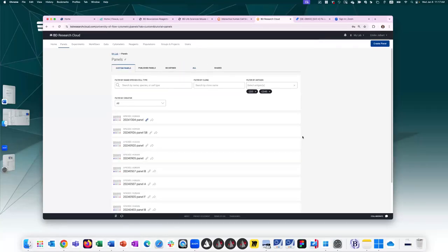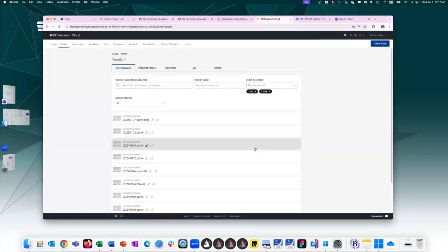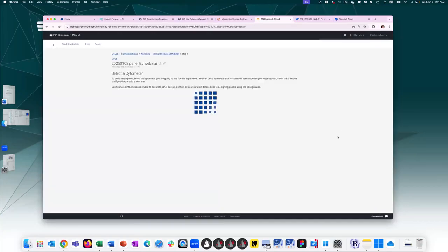But let's go ahead and create our brand new panel using BDRC. To do so, we would hit this blue button in the upper right corner, right below your name, create panel. I'm going to name this panel EJ webinar, for example, and then assign it to a project, and I will be creating a new panel from scratch. So let's go ahead and click start.